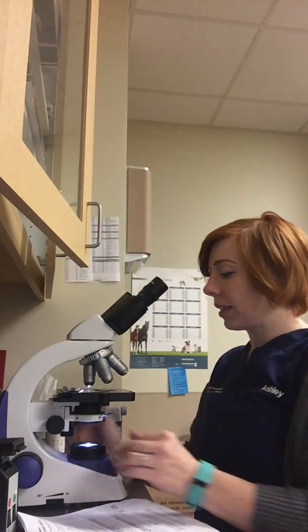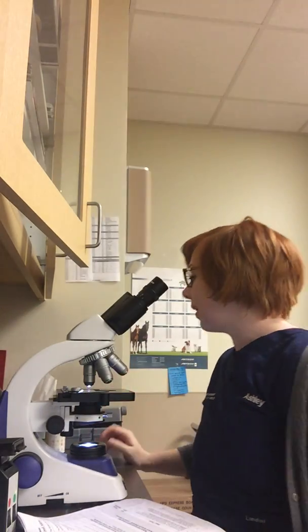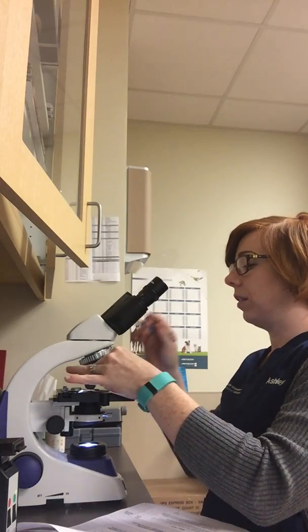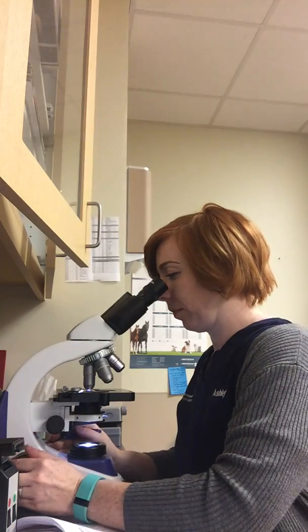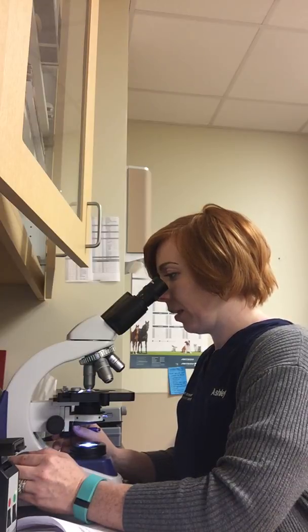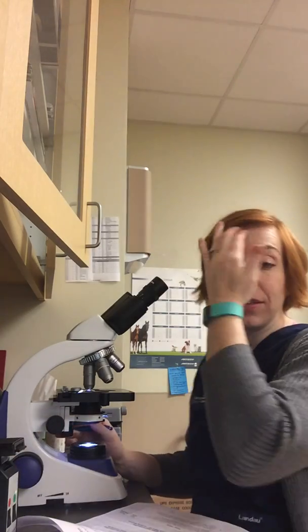So then what I'm going to do next is put it on 40 times. So I'm going to do my estimate on that field. Now we're at 40 times. I'm going to count the number of cells. I'm going to look at 10 fields at 40 times and count the number of cells I see. Then I'm going to do the average of 10 fields and times it by 2,000 for the estimate.